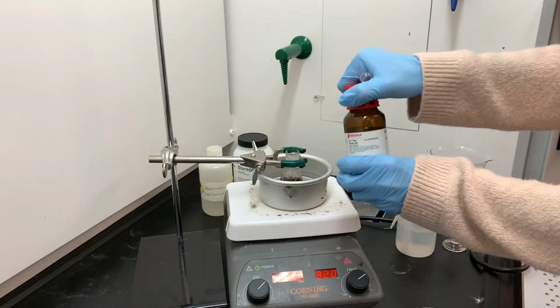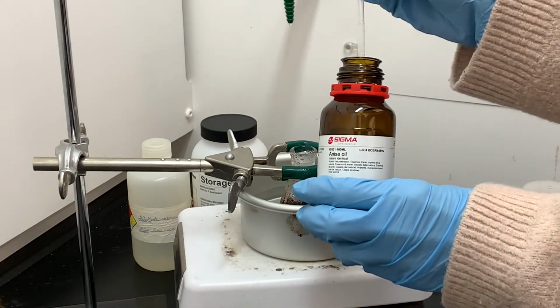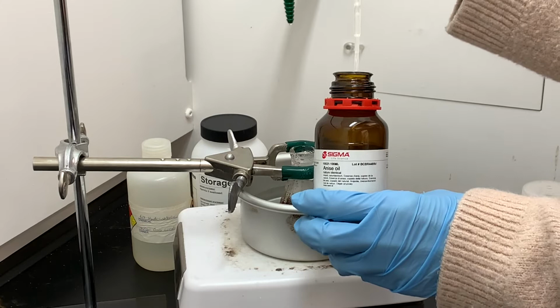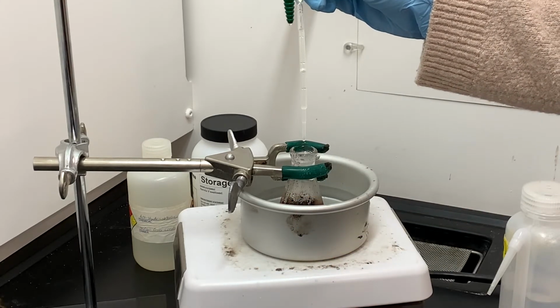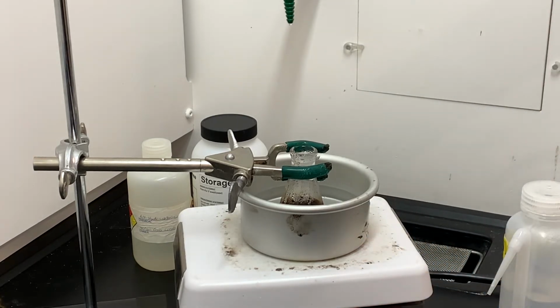The instructions say that I should add about 5 drops of anise oil, but I'm gonna add 10 drops instead. The reason for that is that 5 drops is a really small amount. This reaction doesn't produce much product, and that makes it really difficult to analyze. So 10 drops of the anise oil will make things a little bit easier. This is just gonna sit and react for 15 minutes inside this boiling water bath.